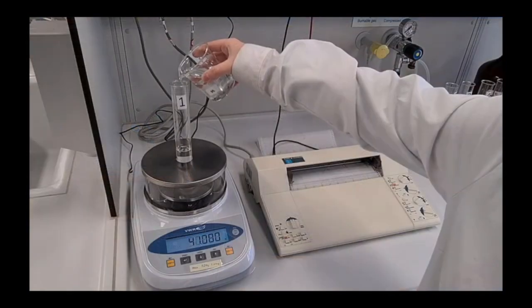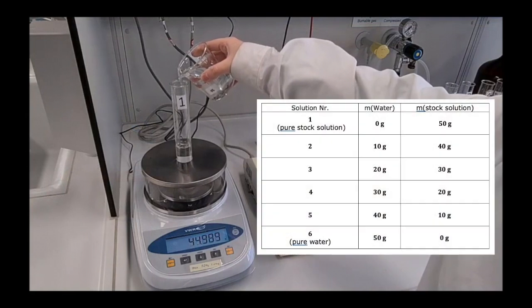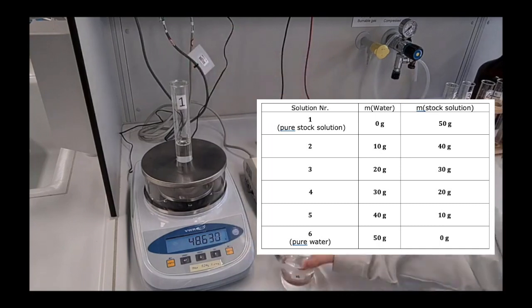Test tubes are filled with stock solution and equipped with a small magnetic stir bar. Ideally, the solutions are prepared on the balance.